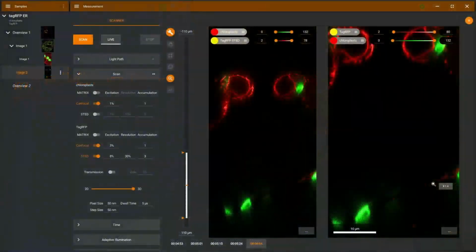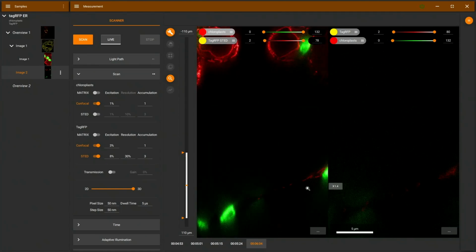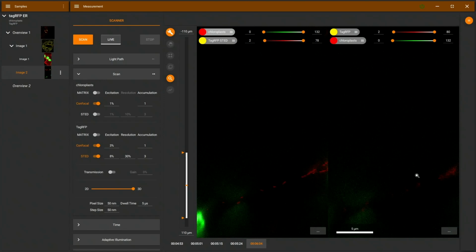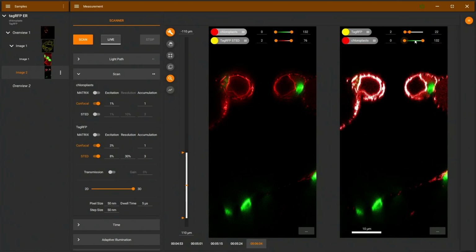I can also adjust the lookup table just a little bit here. But now let's zoom into the structures on the bottom. And on the bottom, we have also nice resolution here in 3D STED mode. And on the right, we can see the confocal equivalent being blurred much more. And now adjusting the brightness back again to the original level.